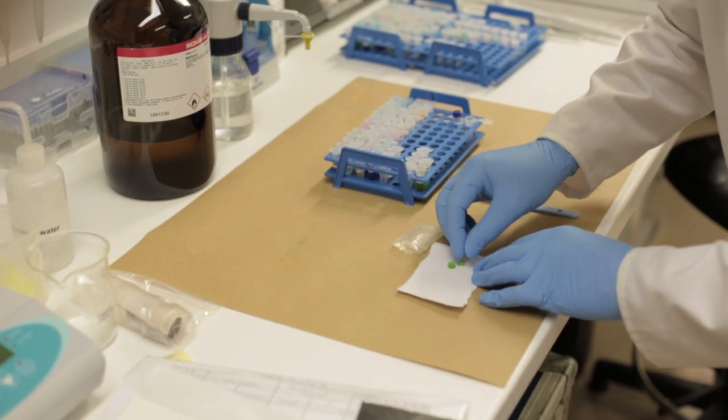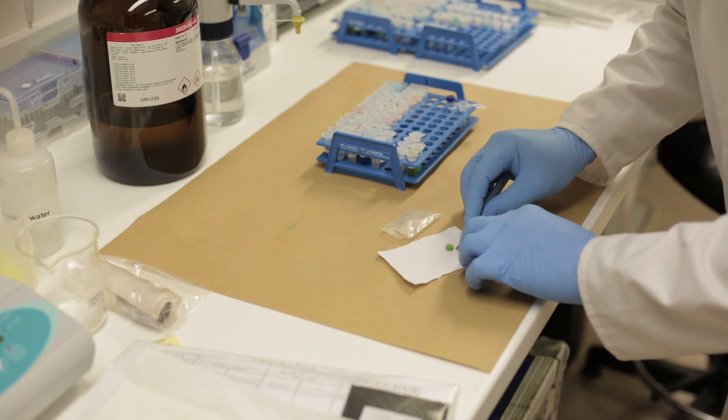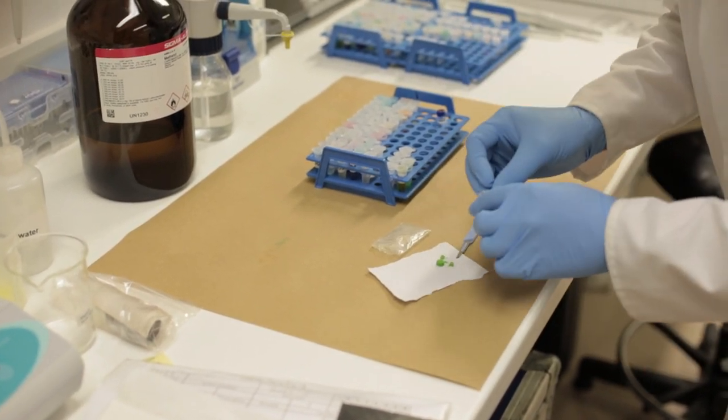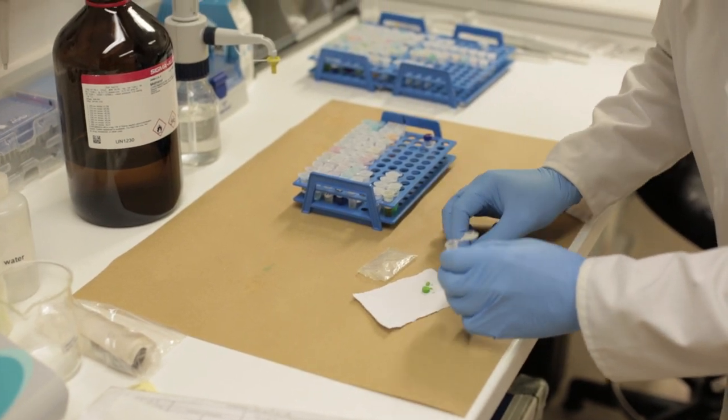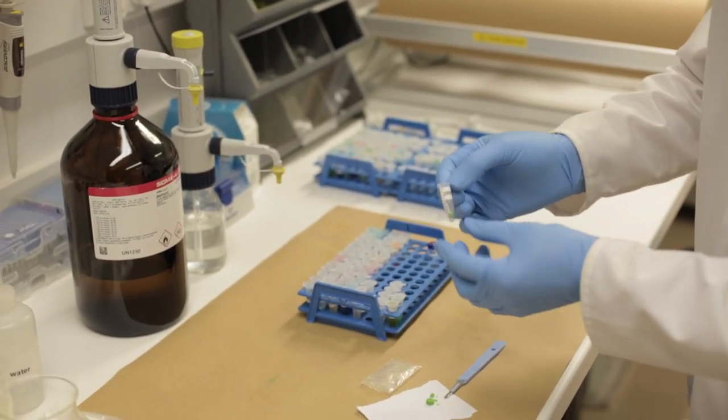We've got a whole tablet and a fragment of one, so I'm going to take half of this fragment and I'm going to put it in a polypropylene tube, plastic tube. And then we've got to extract the drug from it using a solvent called methanol.